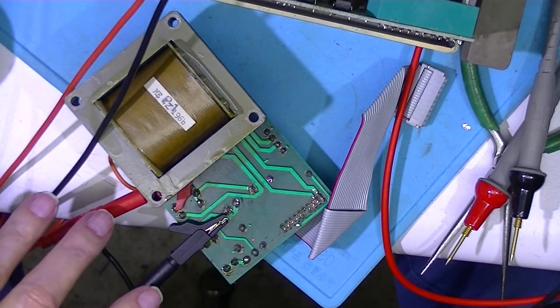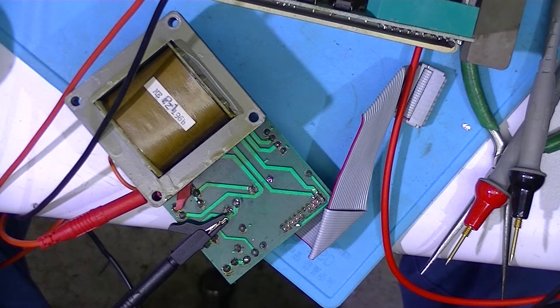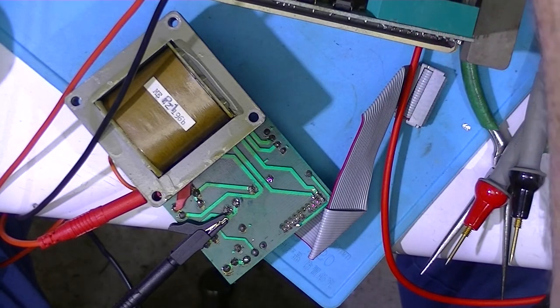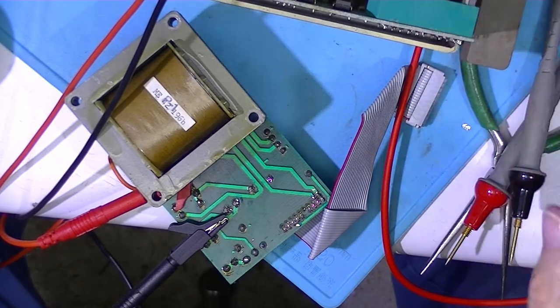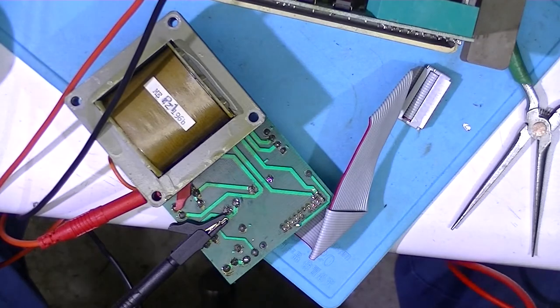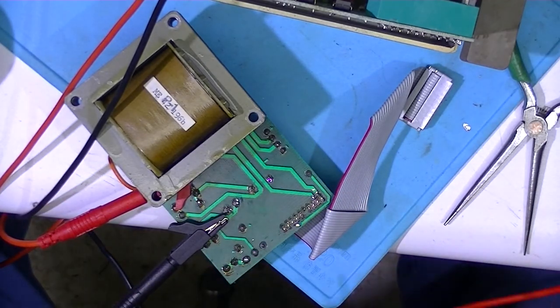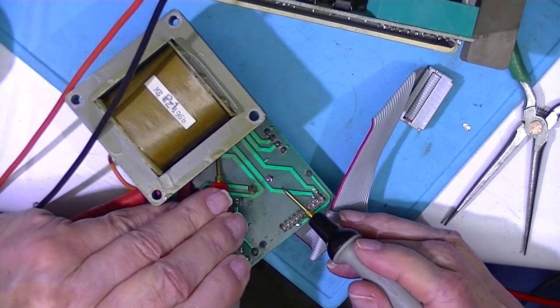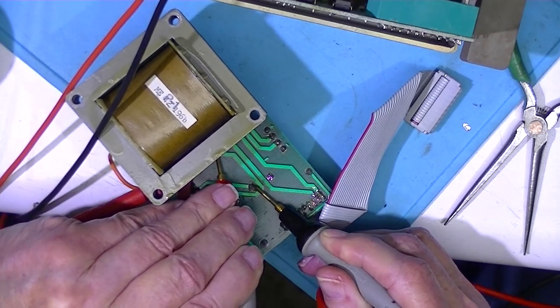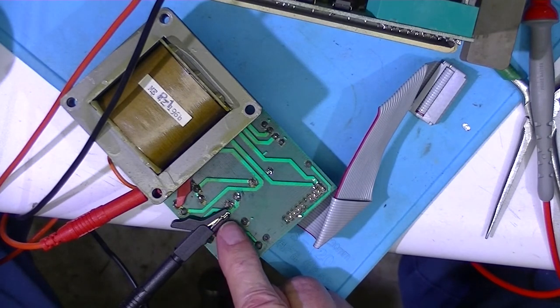Seven being common, and this is my ohm meter. It's reading two and a half ohms which is pretty high really, that's supposed to be normally closed contact. I'm going to put it on sounder. This is connected to a 24 volt power supply and I go across the terminals of the coil. You see the relay opens. The relay contact is actually unused.